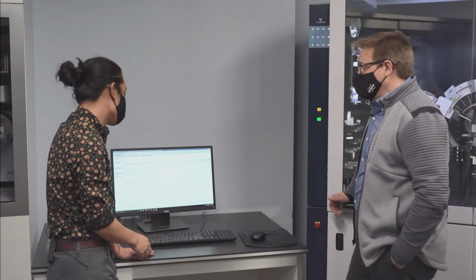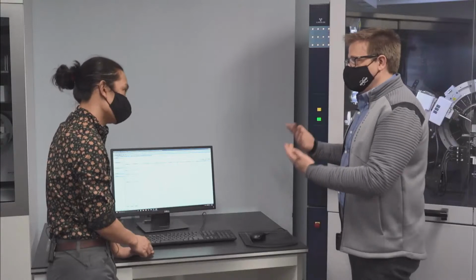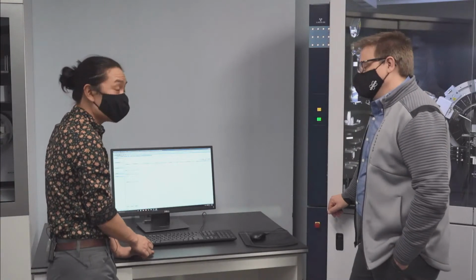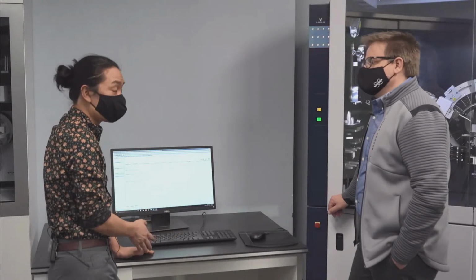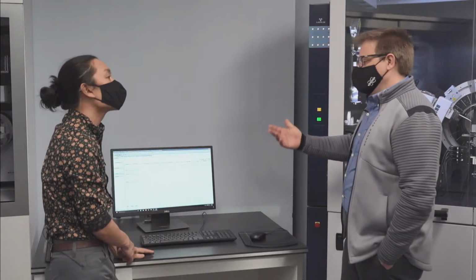Yeah, and one of the other nice things is that you actually get a decent 2 theta coverage, so you might actually collect 2, 3 pole figures all at once. At the same time. Yeah. Right. So if they're close enough together, you might be able to only measure one thing and get a complete ODF because you've got 2 or 3 reflections in the same scan. And there are wizards like this to support if you're doing 0D, 1D, or 2D modes.